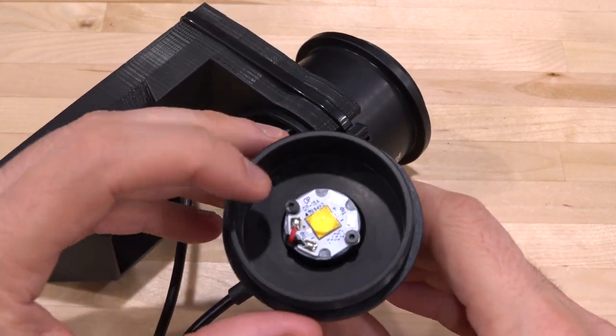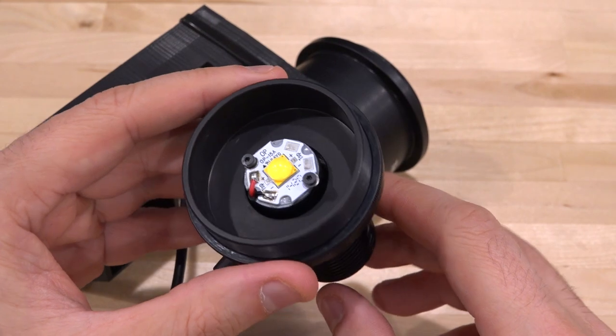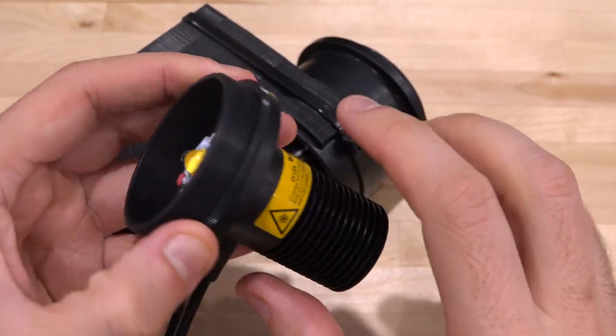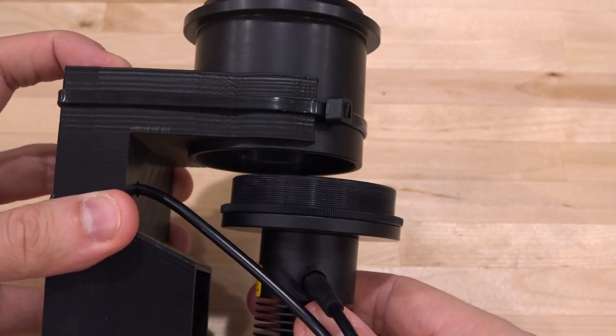Now, this used to come in with a 5-watt LED, but I replaced it with this one, the one that I bought from DigiKey, and I'll post the part number so you can take a look at it. It puts out a tremendous amount of light, but it is 25 watts now. And because it's 25 watts, this is no longer enough. The other piece of this was the piece over here. This is the lens, and this just simply screws into this.